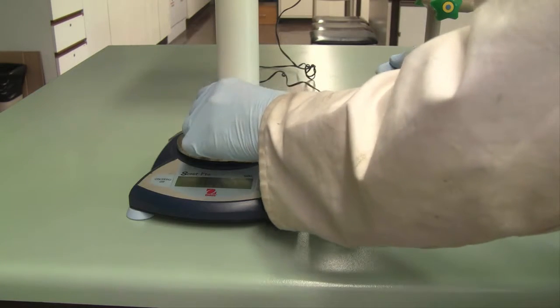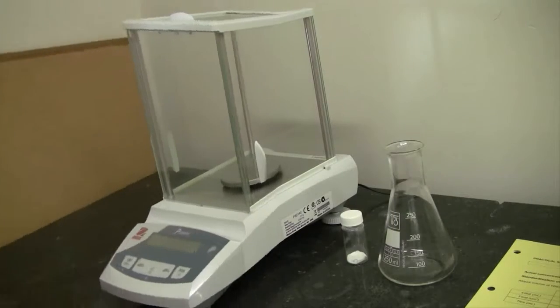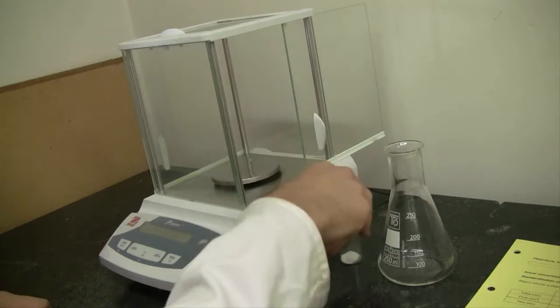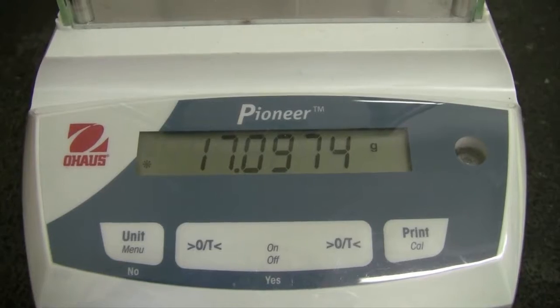You're also being technique tested on your ability to weigh by difference, so make sure you call over your demonstrator and ask them to watch you complete this. Zero the analytical balance with all the doors shut. Pop your sample in and weigh accurately to four decimal places.